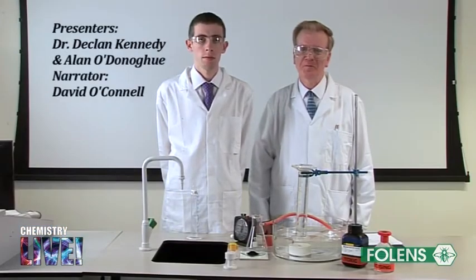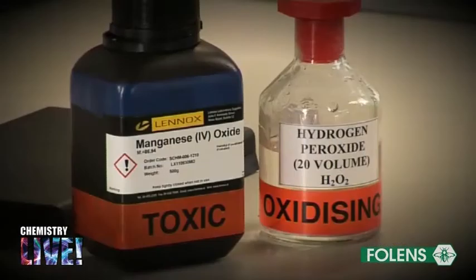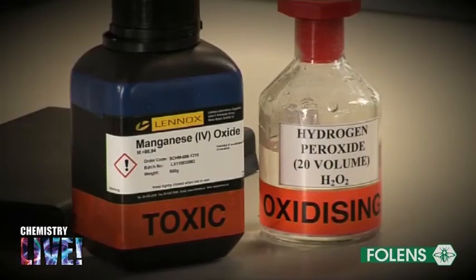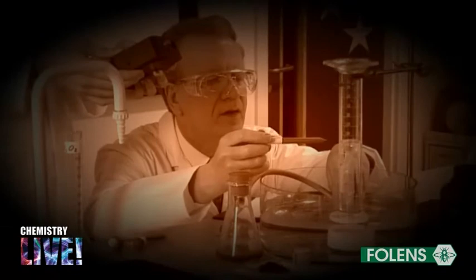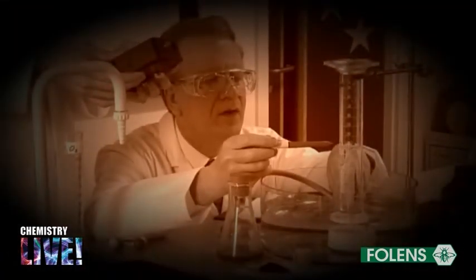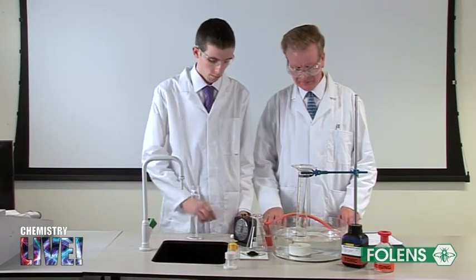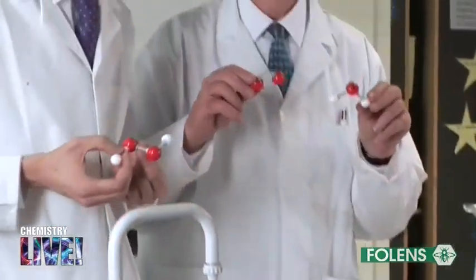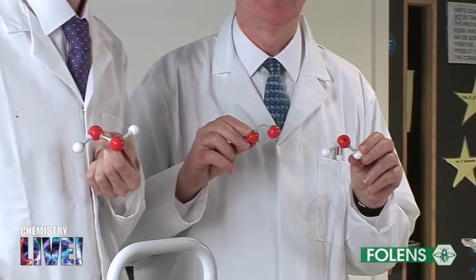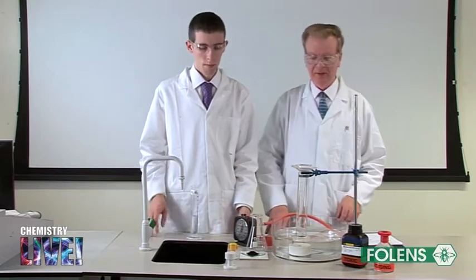Experiment to monitor the rate of production of oxygen gas from hydrogen peroxide using manganese dioxide as a catalyst. In this experiment we will investigate the rate at which oxygen is released from a sample of hydrogen peroxide. Hydrogen peroxide decomposes slowly into oxygen and water. However, the rate at which it decomposes may be increased by adding a small amount of manganese dioxide.